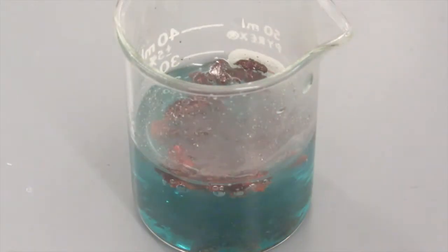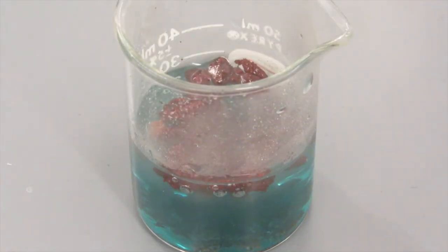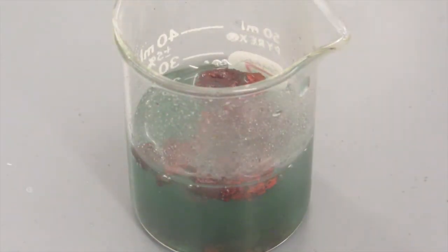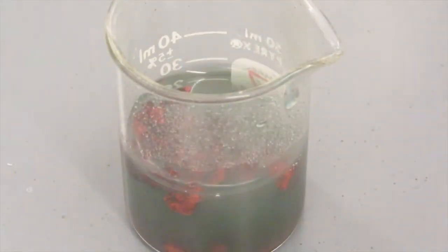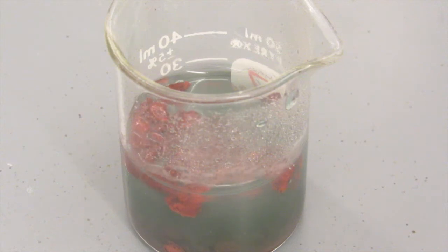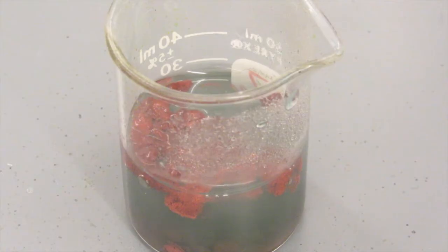The reaction takes about 15 minutes to complete, so I speeded the video up about 20 times as fast as normally would be seen. You can see a lot of bubbles forming right above the water level. This reaction is very exothermic and lets off a lot of heat, so some of the water gets turned into water vapor and then recondenses on the outside.